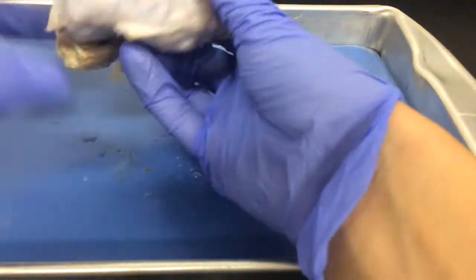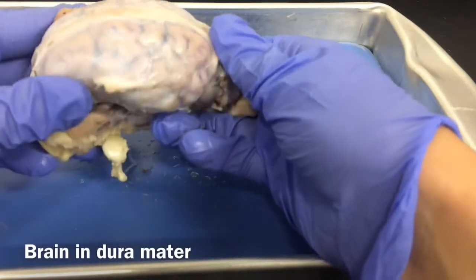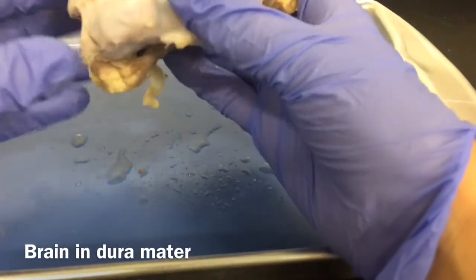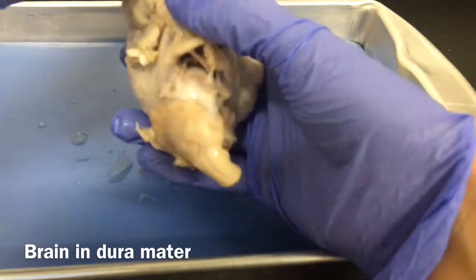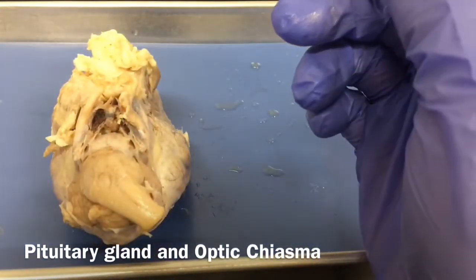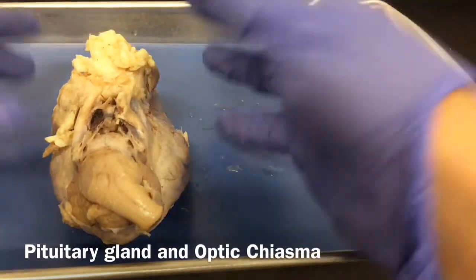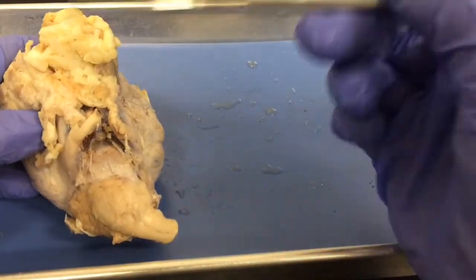You'll probably get a brain that starts out like this, and it's enclosed in this outer covering called the dura mater. And we can still look at some structures before we actually take this brain apart. We can see the pituitary gland and optic chiasma if we look carefully. All right, so we have our pituitary gland in here. And remember, our pituitary gland is part of the endocrine system. It's going to produce critical hormones, which of course are chemical substances that are going to control lots of our body functions. And we also have our optic chiasma.